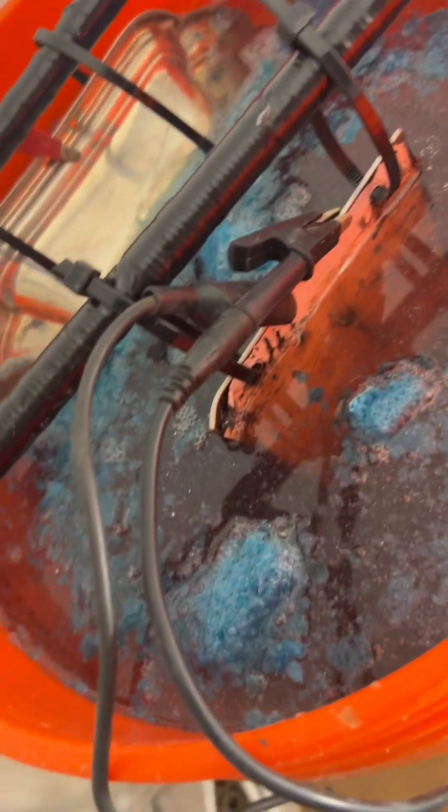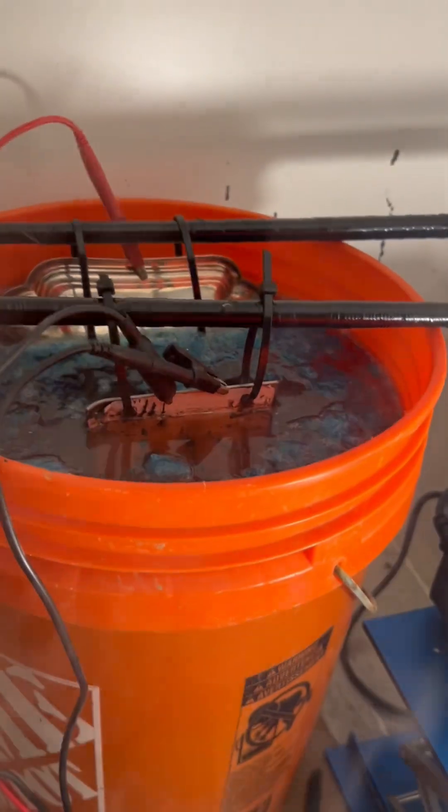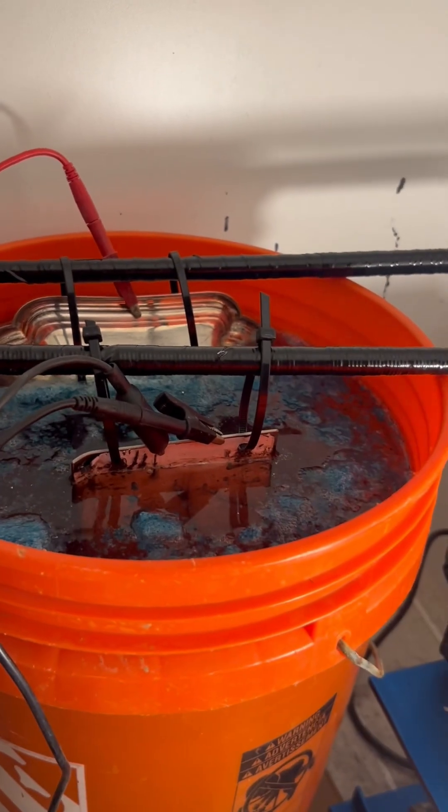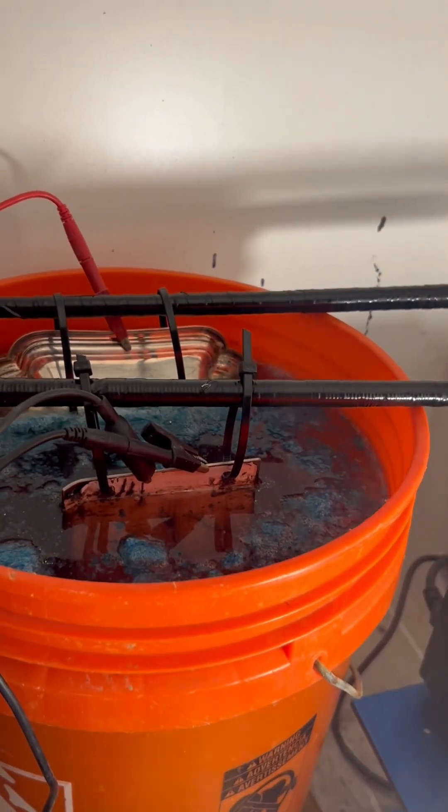We'll process it. I'm not gonna worry about that little bit. I'll put it in a beaker, and we'll clean it up. I'll take that plate, and we're gonna smelt it to capture it.